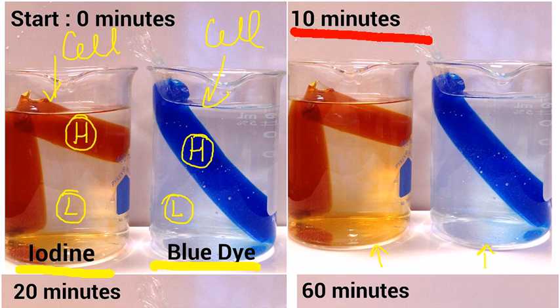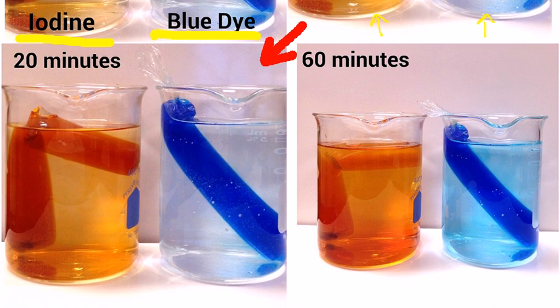The same thing goes for our blue water here. If we observe the water after 20 minutes, we'll notice that the water is changing color again. This time, the iodine is becoming darker, and also the blue is starting to show signs of becoming darker.